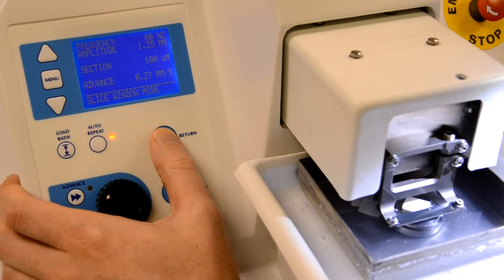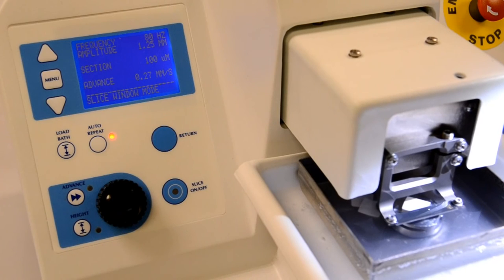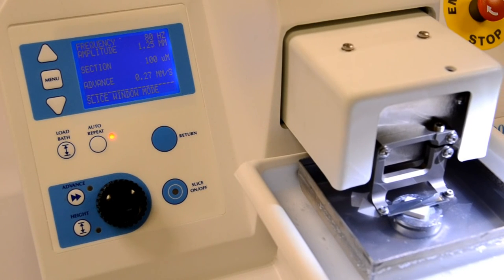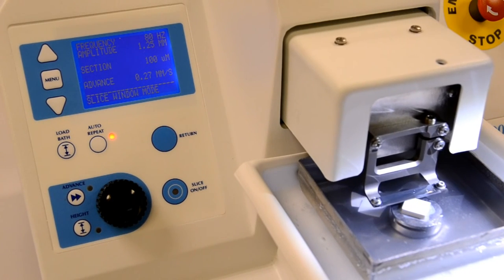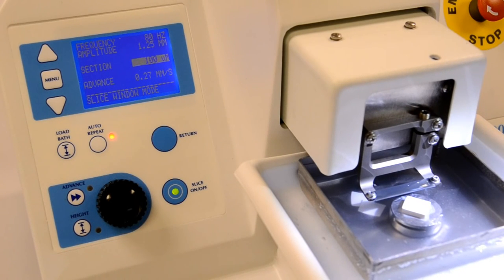Toggle between auto-stop at end and auto-stop at start using the arrow keys. If you set the option to auto-stop at start, you will not have to press the return key before pressing the slice on-off key to repeat the cut. The operator's manual shows this in more detail.